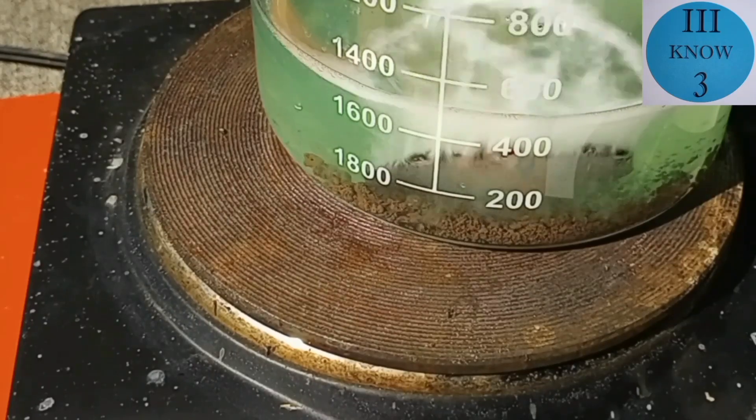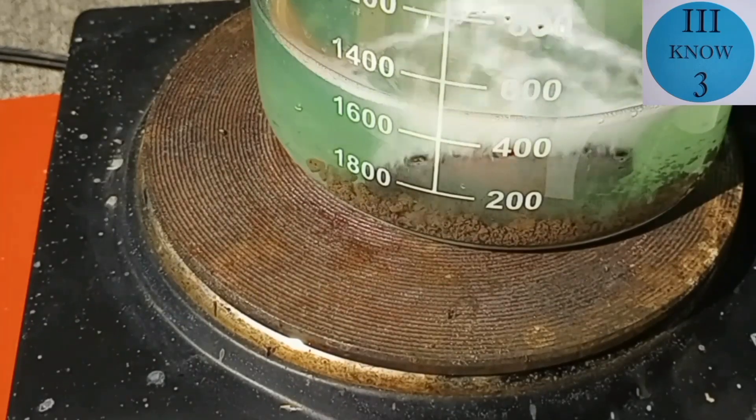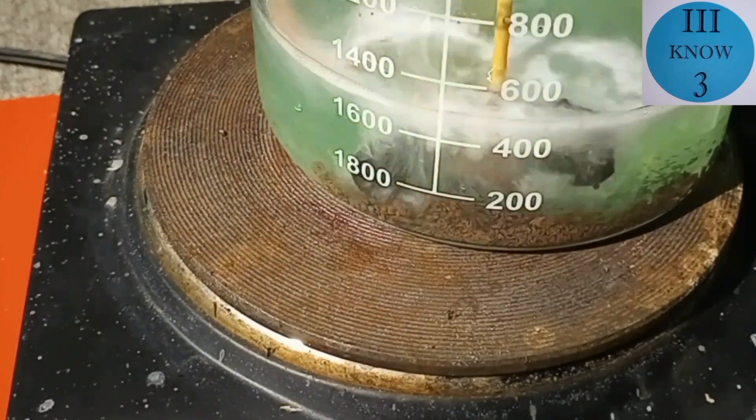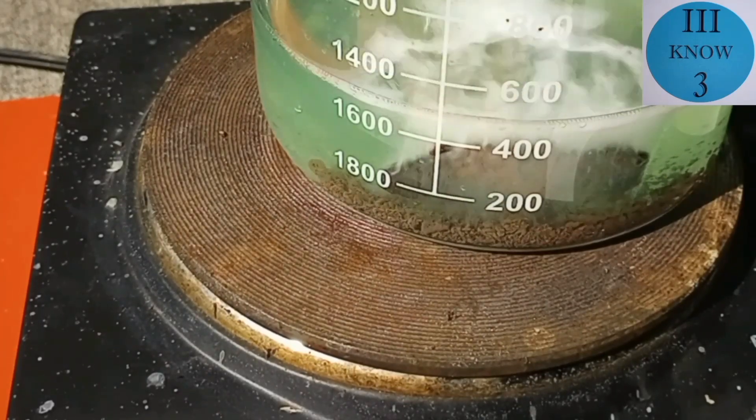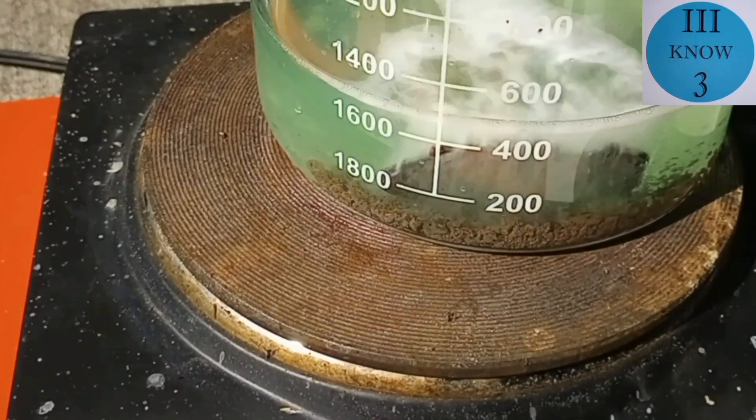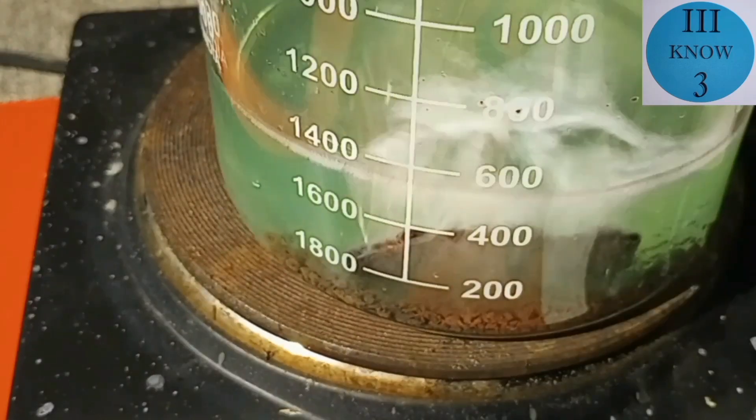So at this time all of the smaller pieces of zinc have completely dissolved as far as I can tell. And the big piece I pushed up against the side of the beaker so you can see it on the camera.